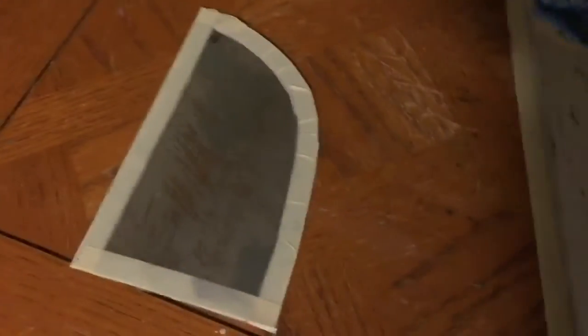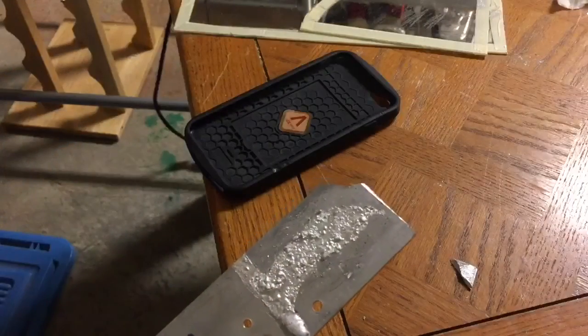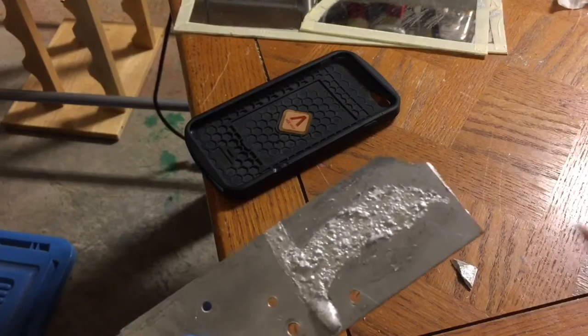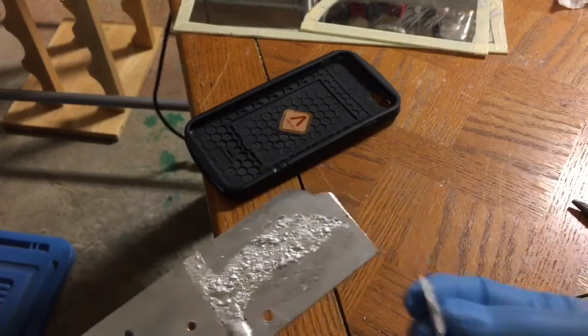The mirrors can be further stabilized by just putting some scotch tape on the back of them, which gives a more durable end product. These have been treated with scotch tape. On a final side note, this is a piece of aluminum that I put some gallium on the previous day and it's just crumbling apart.